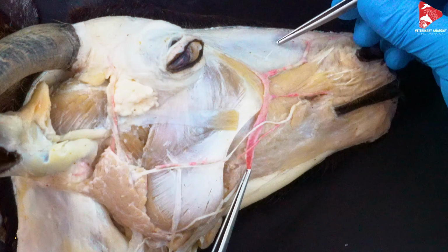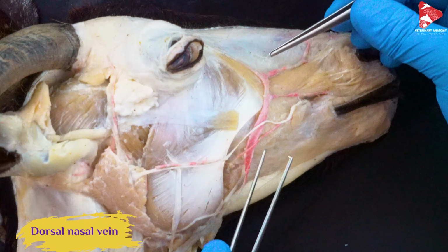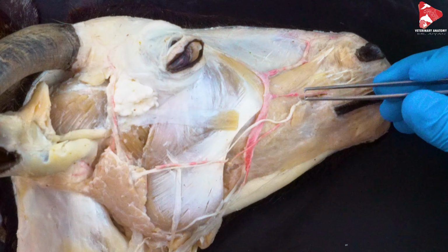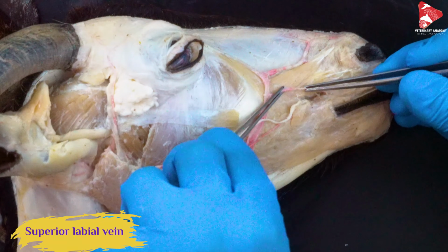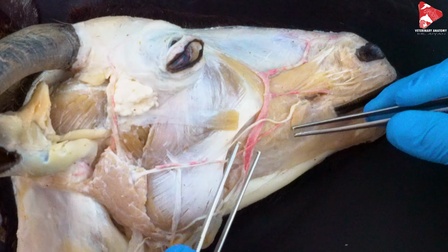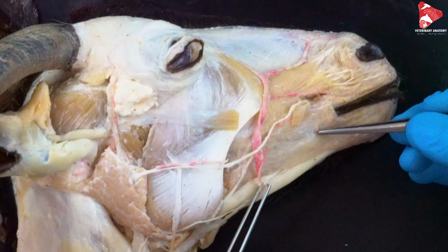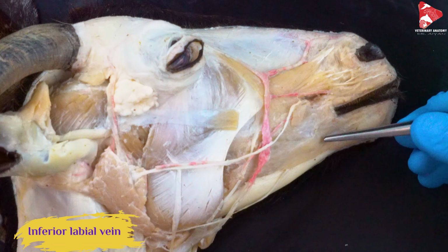Actually, we should have another vein here called the dorsal nasal vein. It's not here, we cut it accidentally. Here we have the superior labial vein, which comes from the upper lip, and we should have another one located down here, called the inferior labial vein.